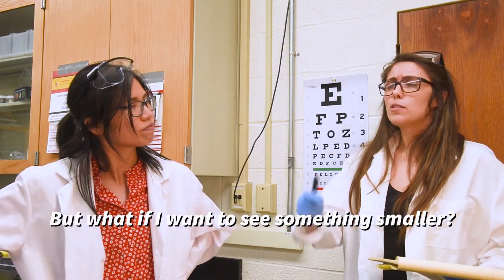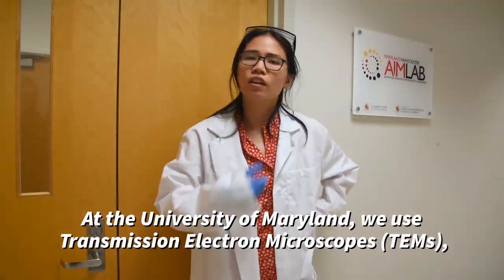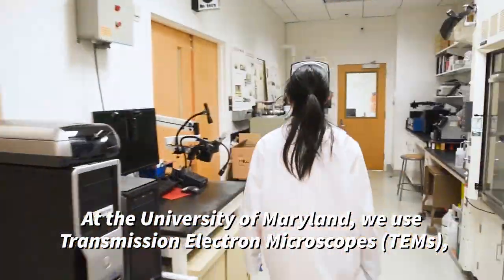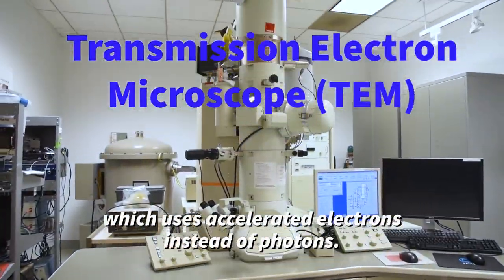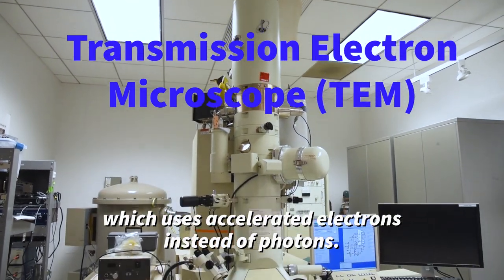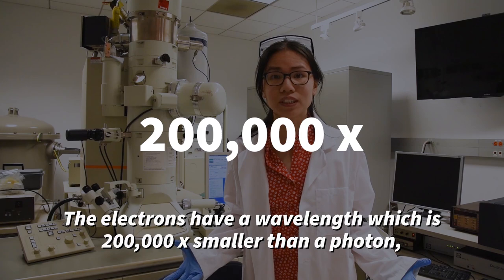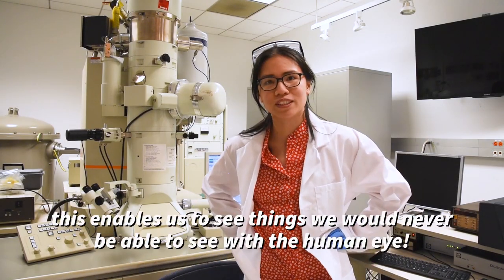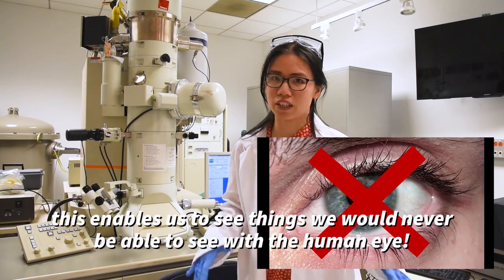But what if I want to see something smaller? At the University of Maryland, we use transmission electron microscopes, which use accelerated electrons instead of photons. Electrons have a wavelength which is 200,000 times smaller than a photon. This enables us to see things we would never be able to see with the human eye.